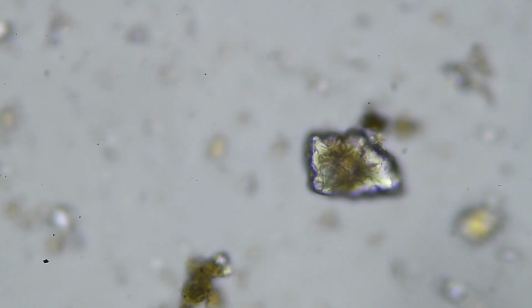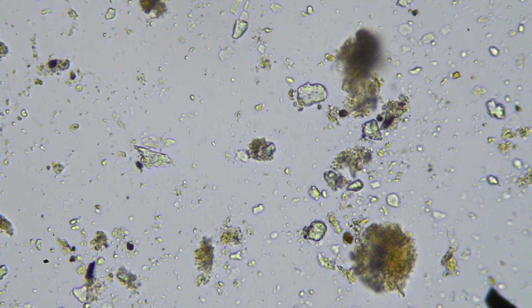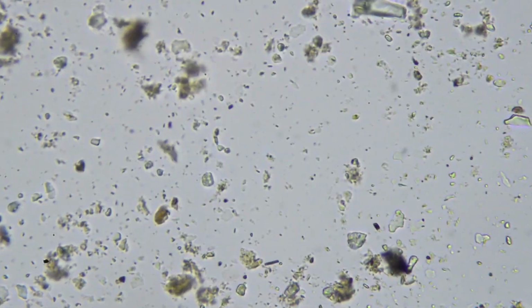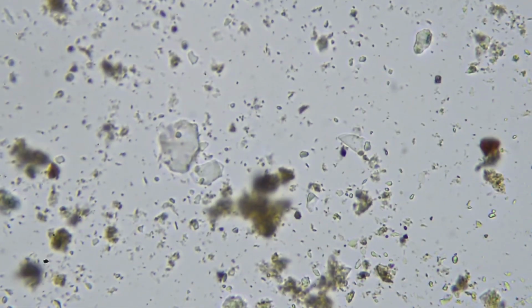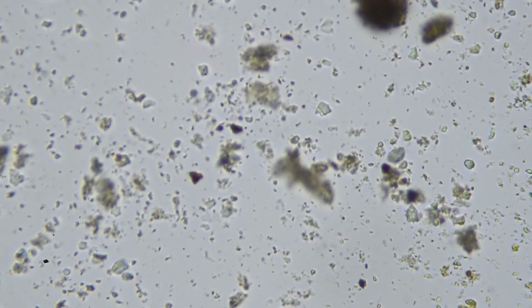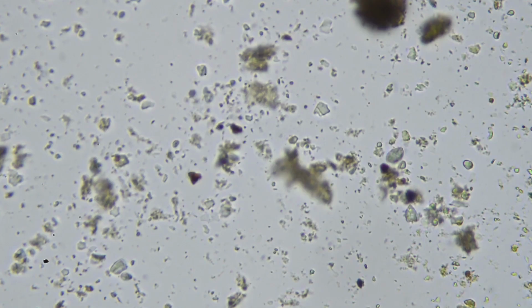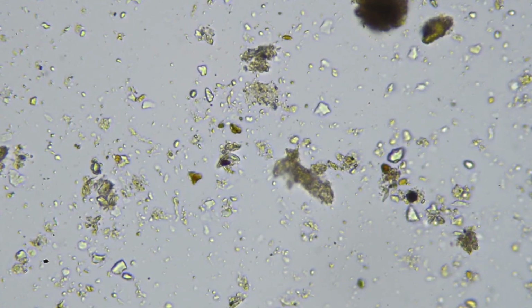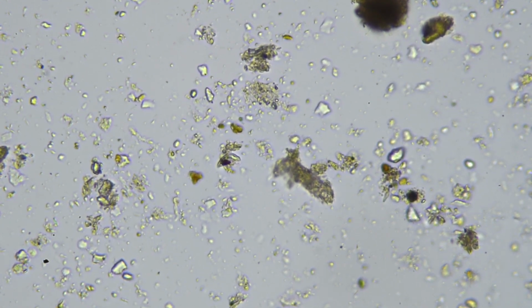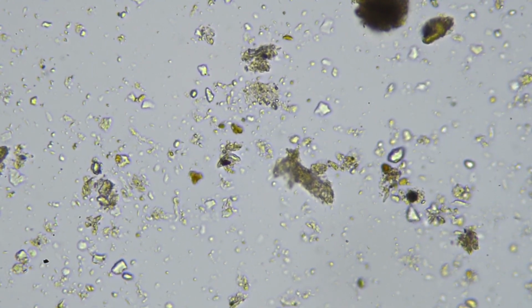That's a big bit of ulmic acid there, I believe. So that's quite nice. And typically, especially if you're doing all your carbon audits at the moment, I know you want to see really high fungal numbers, because those are the things that are going to sequester vast quantities of carbon for you in the soil when they respire. On average, this is talking about so-called beneficial fungi, so not oomycetes or pathogenic fungi, although that's a whole different conversation. But anyway, we'll not try and get too complicated here.